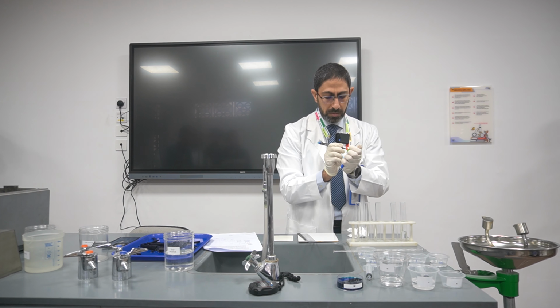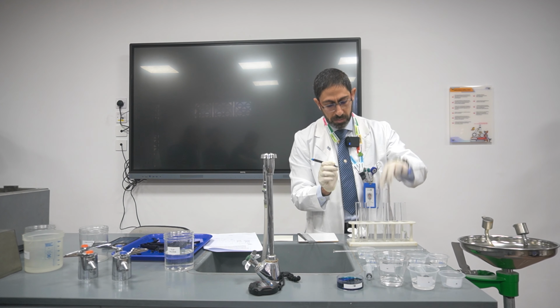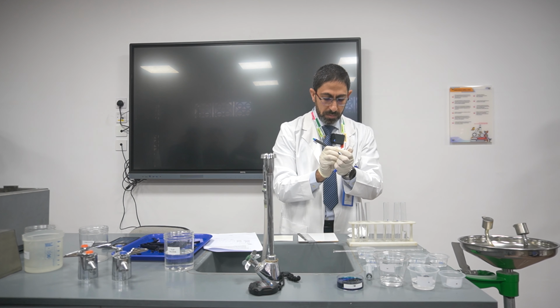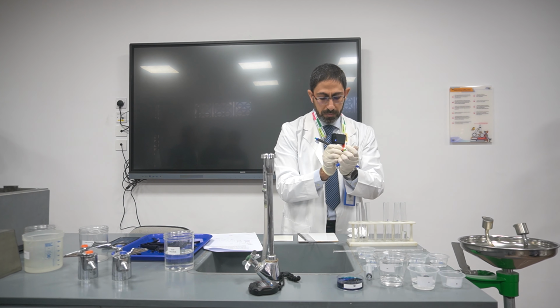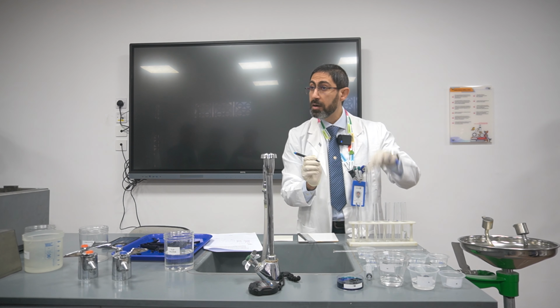Afterwards will be 0.1. Afterwards there will be 0.01.